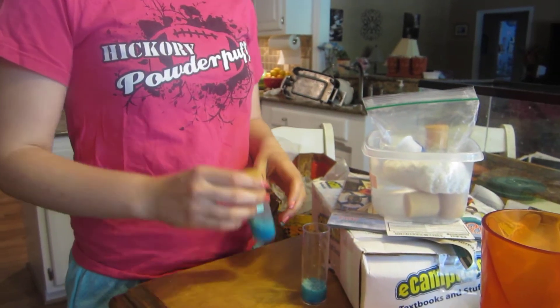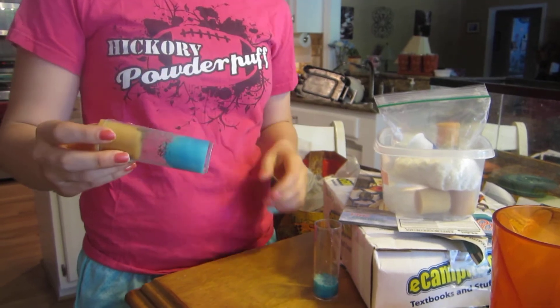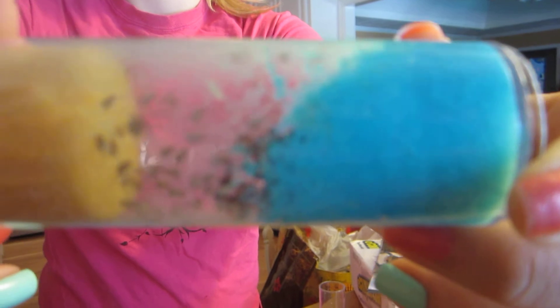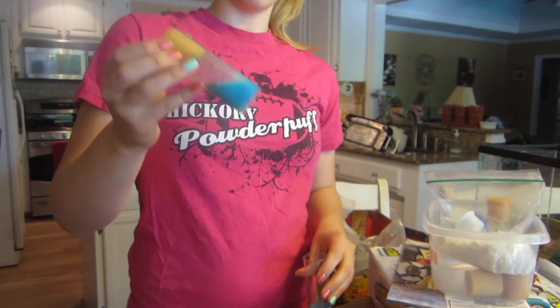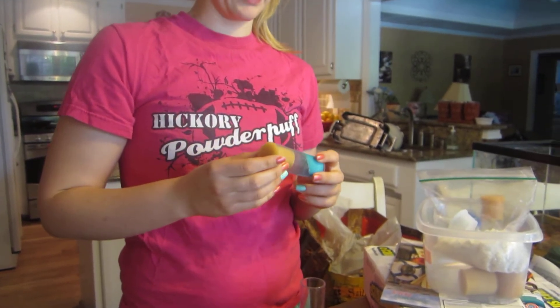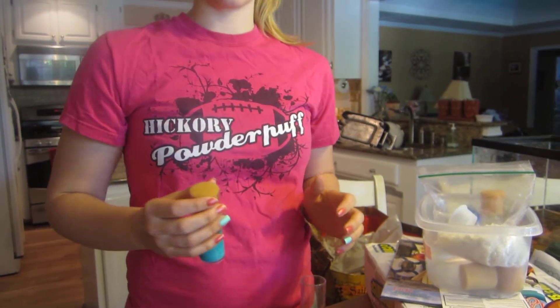I'm going to show you how to transfer fruit fly populations to another vial. Here are fruit flies right now, and if you look really closely you can see the larvae — they're the white maggot-looking things. The reason I'm transferring them is because the larvae are a different age than the actual fruit flies, and I want the generations to be all the same age.